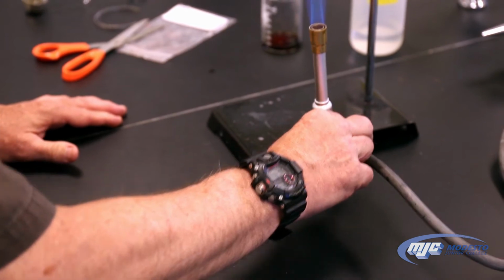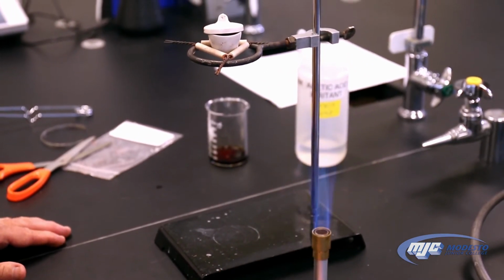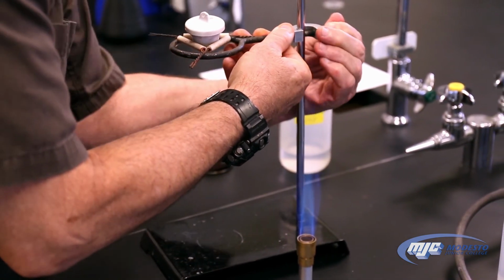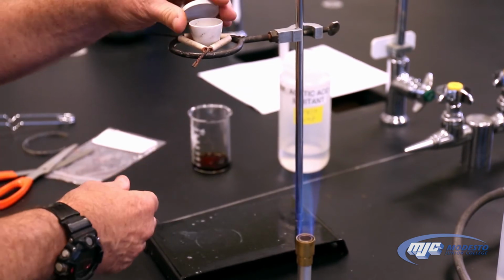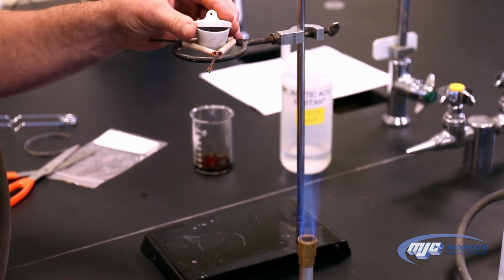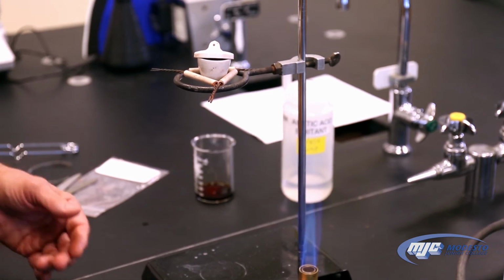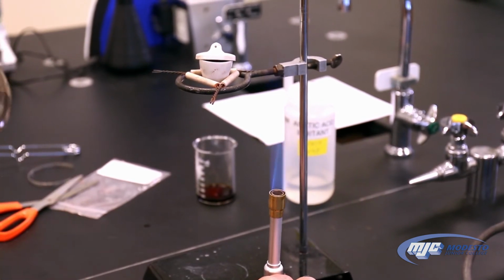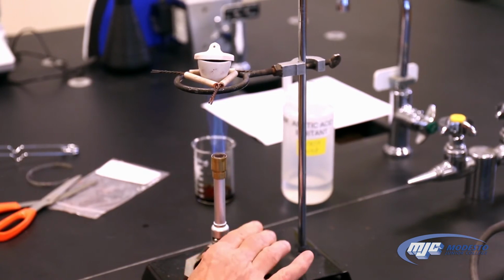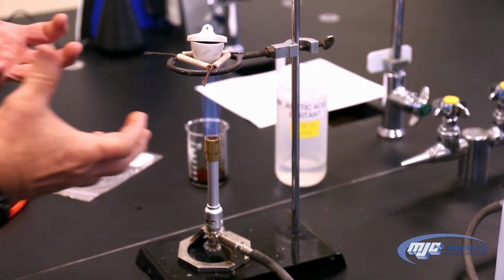So if I hold it up next to it, you can see that it looks pretty good. It might be a little bit low, so I'm going to move this up a little bit, tighten this guy down. And we also want to make sure, by the way, that the cover of the crucible has a little opening there. We need some way for the oxygen to get in and react. So that looks like that height's pretty good. I'm going to stick it under here, and we're going to let it heat up for 20 minutes. It's going to glow red, orange.